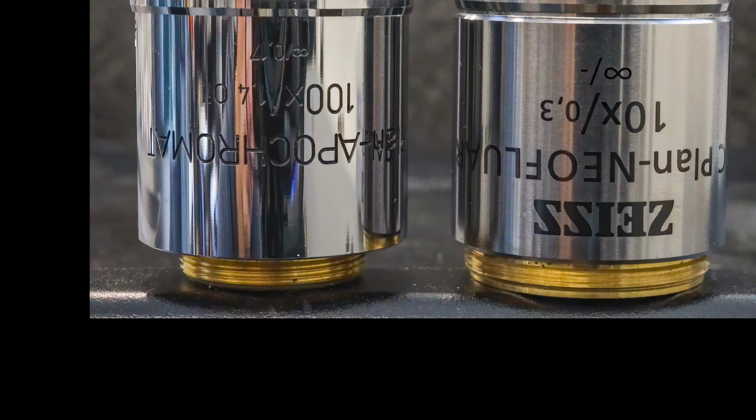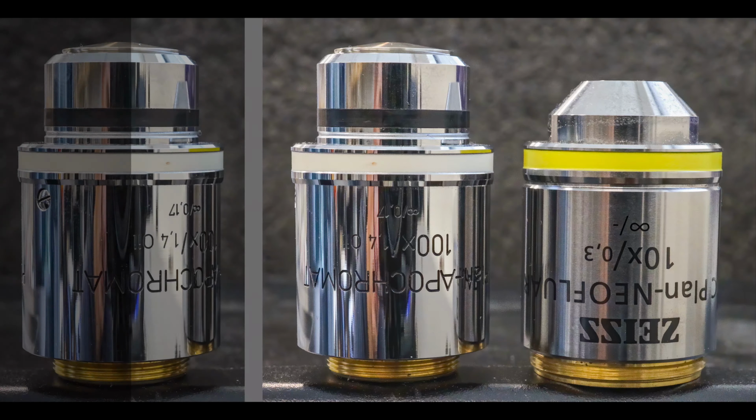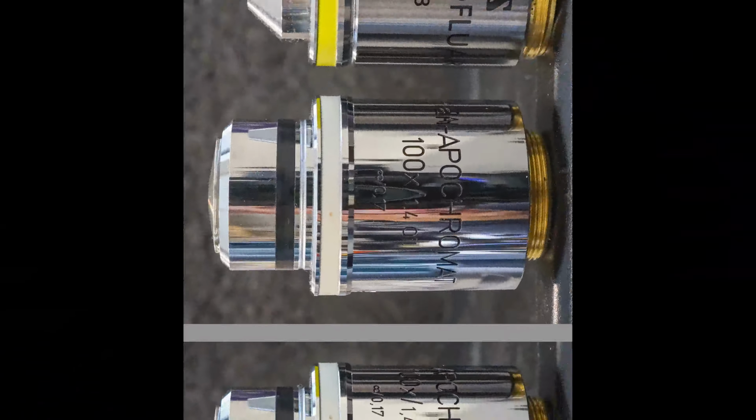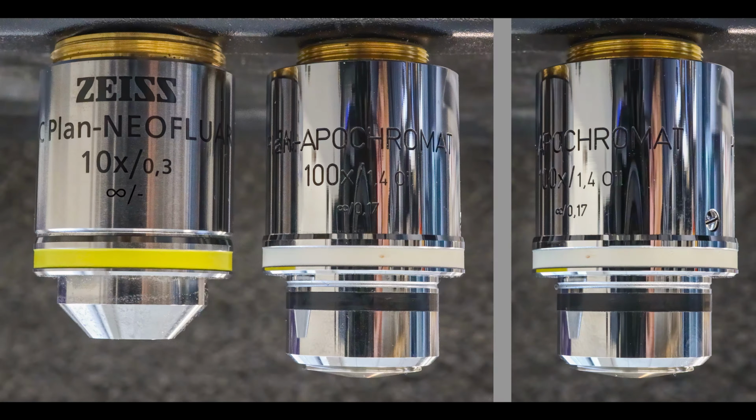Now let's look at the objective markings. I'm adding another picture of the objective on the left so everything can be read clearly. Let's also turn this picture by 180 degrees so the orientation of the objectives is the same as it would be in an upright microscope. In addition to the names or types of the objectives, we see four different quantities. They are the magnifying power or magnification, the numerical aperture or NA, the tube length, which here is infinity.